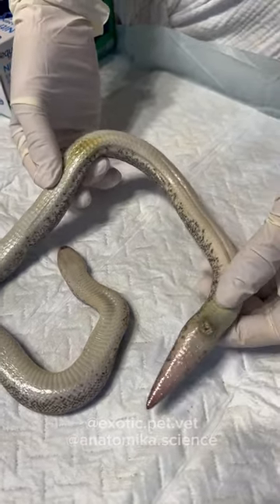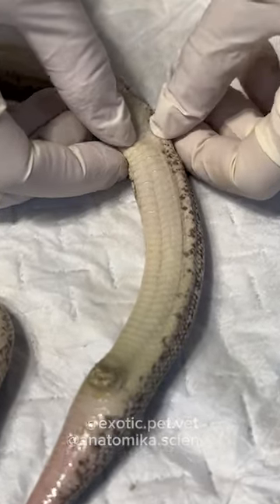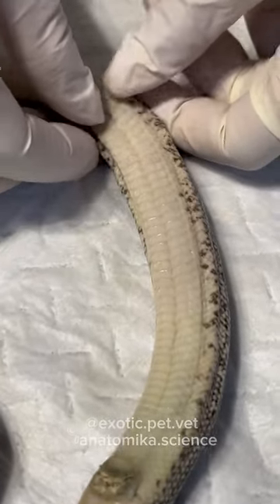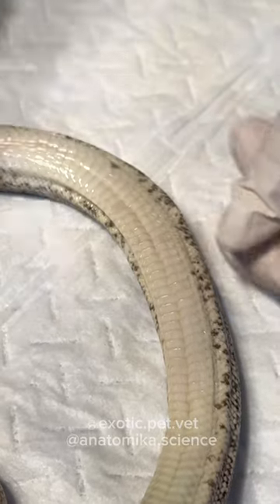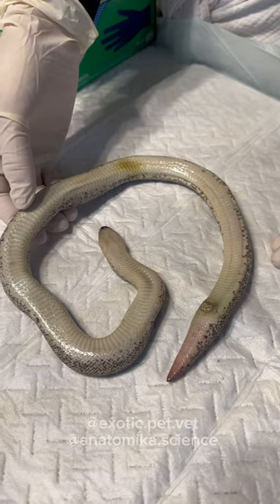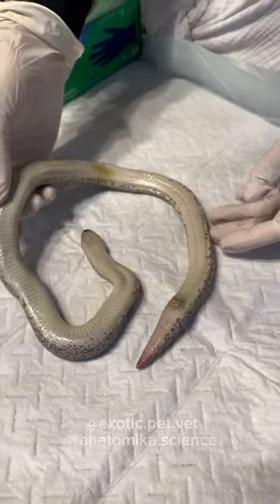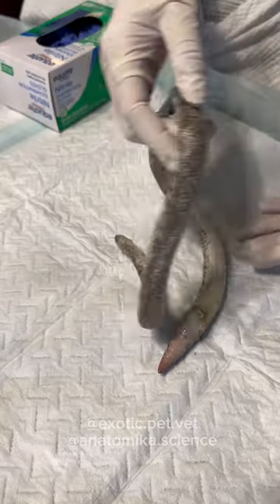This is related to decomp. It seems pretty dry with a lot of folds in the skin, so I would say it's been dead for about a day, maybe, but not more — less than 24 hours, not frozen or refrigerated. Would you say it's still good for histology or tissue culture?